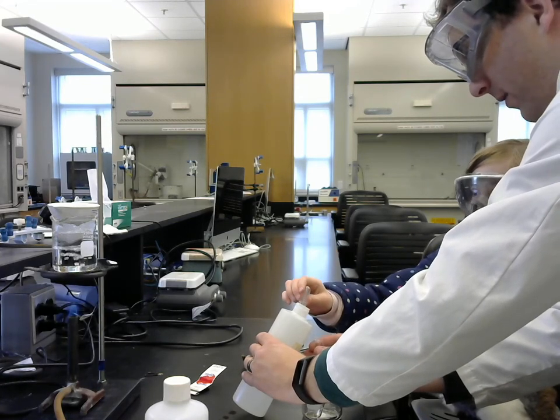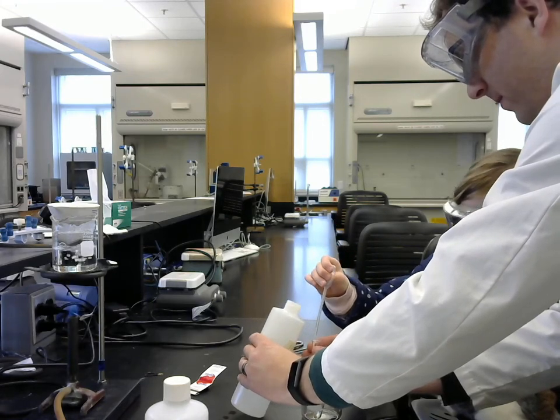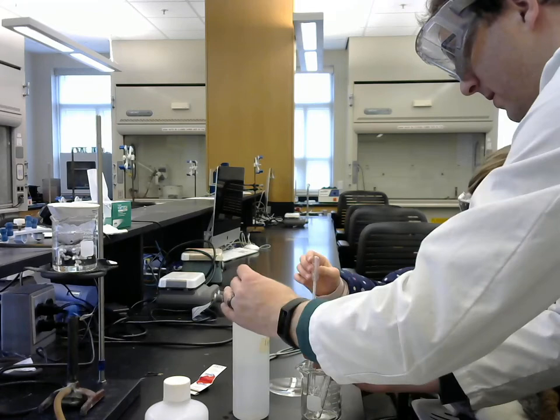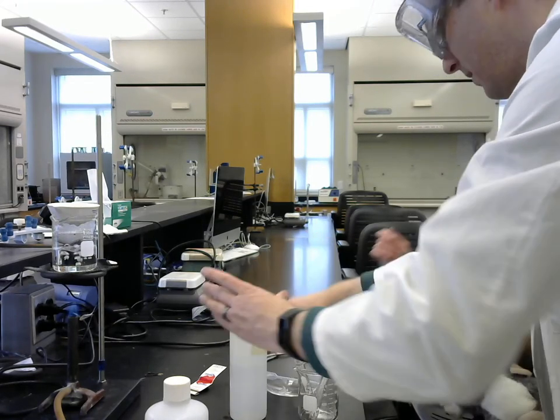And this is an acid, right? Ish? Well, we're going to find out actually. Okay, I know that some of this stuff is going to be acid because I heard Dad talking about it, so I'm just going to be careful around my hand.